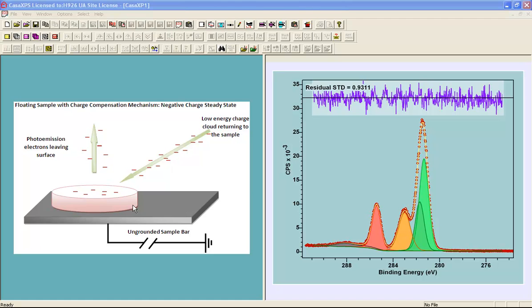The analysis just performed is performed on the basis that the sample has a uniform potential and it is also in a steady state for the duration of the measurement. Now we may have the scenario where we have a steady state, but we may not necessarily have a uniform distribution. And the example that I'll now illustrate is a material that is silicon oxide on silicon, but the charge compensation combined with the sample itself produces more than one steady state that must be separated if we want to see spectra of significance to the chemistry of the sample.